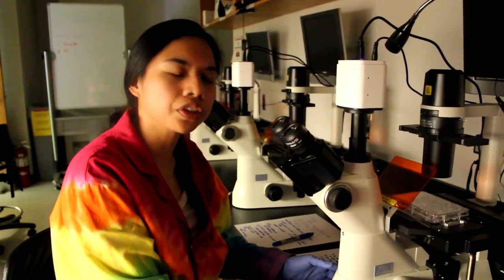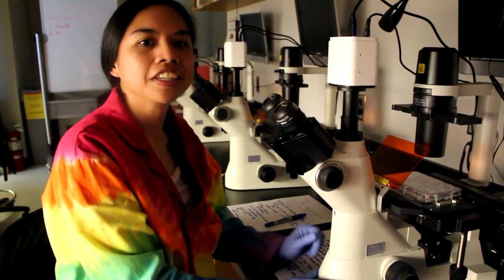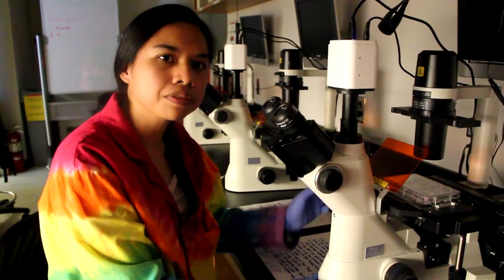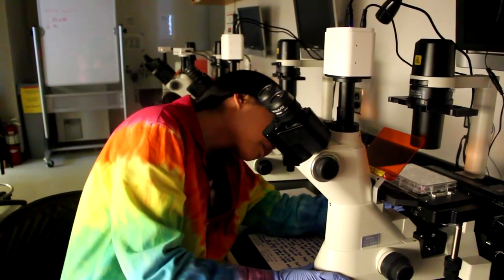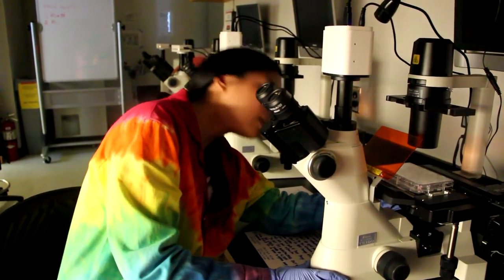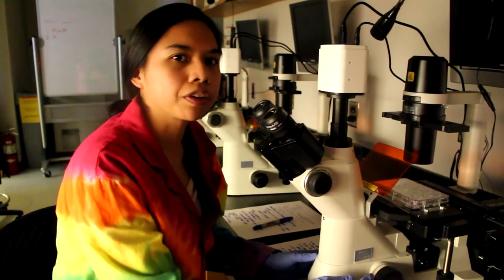To visualize our cells using fluorescence, we're going to need to turn off the bright field, use the silver objectives, and the light source at the back of the microscope.